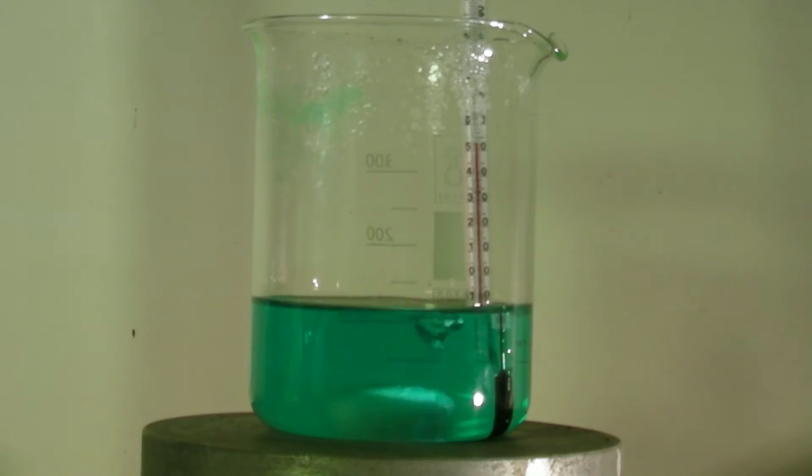The solution is back at its initial condition but this time the Cu2+ is already in the solution. After a short period of time, the reaction starts again.